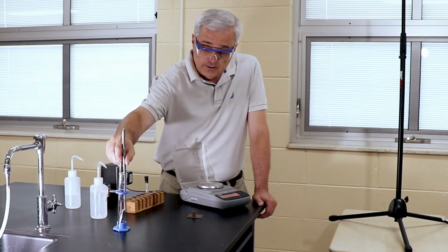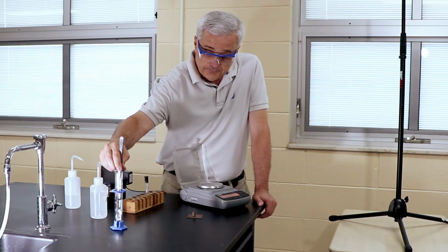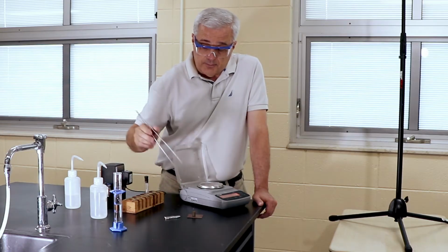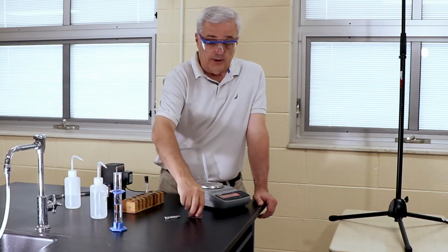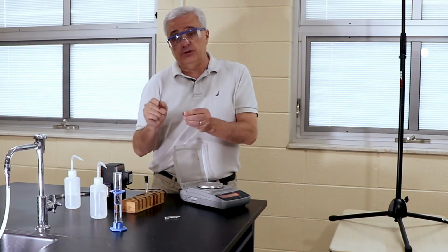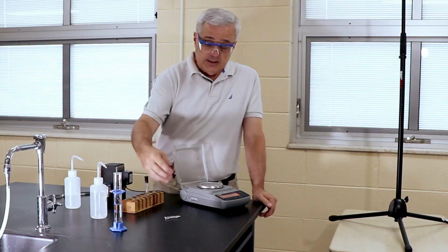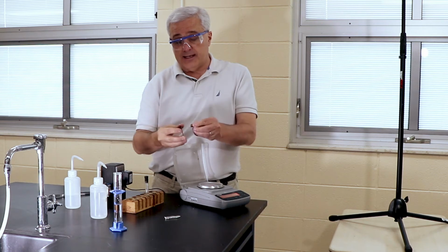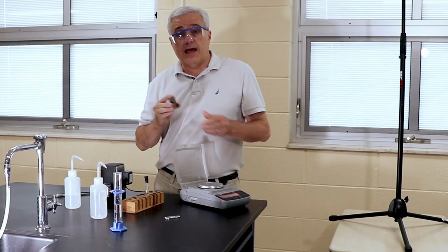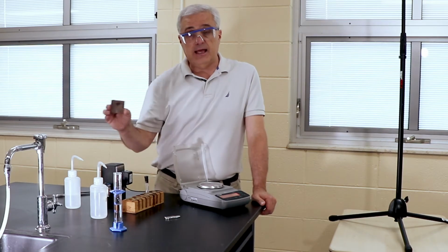Another test that's very simple to do is to test it for magnetivity. We do that simply by approaching it with a magnet and determining. The magnet I have is round, and I have it stuck to a piece of metal so that it doesn't roll off the desk. As you can see, if the sample is magnetic, it very aggressively attracts. So the last test we're going to do is to approach the sample with the magnet and see what happens.